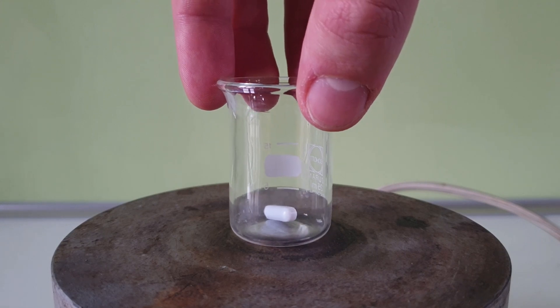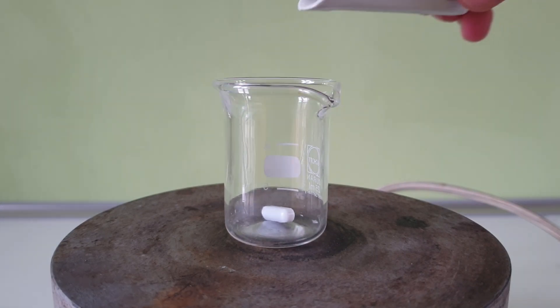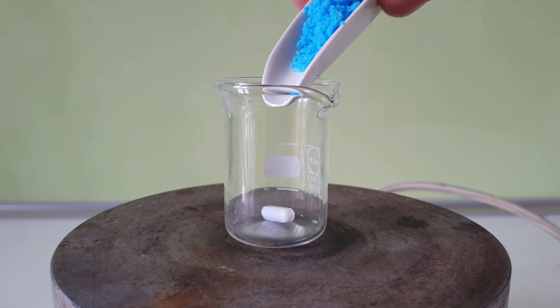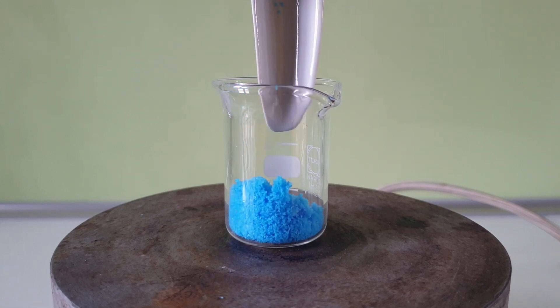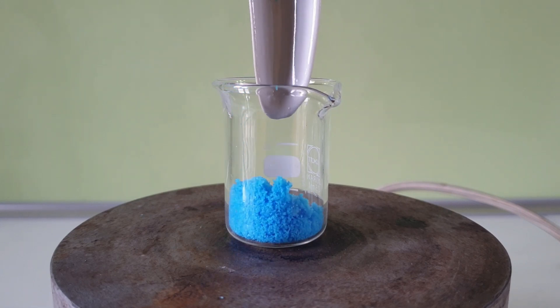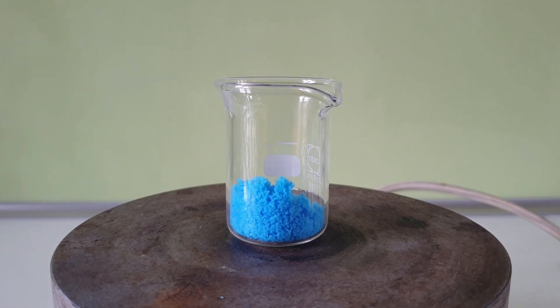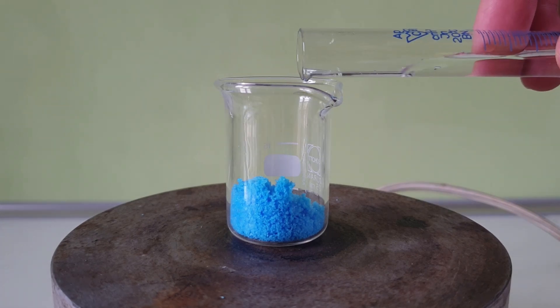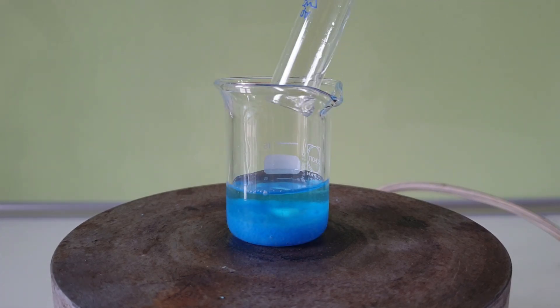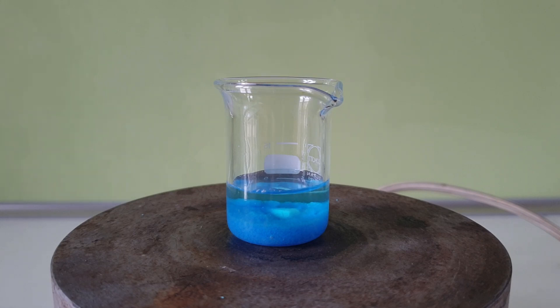To start off the synthesis, I add 4.1 grams or 16.4 millimoles of copper sulfate pentahydrate to a beaker. You can also use the equivalent molar amount of copper nitrate or chloride for this reaction. The copper sulfate is then dissolved in 8 milliliters of water by heating the solution to 90 degrees Celsius.